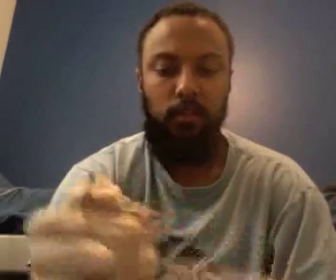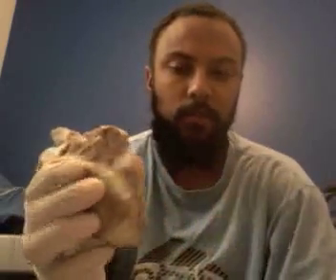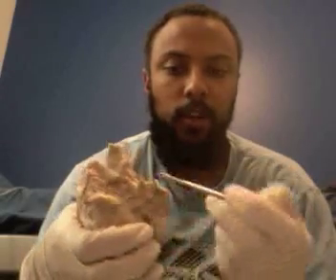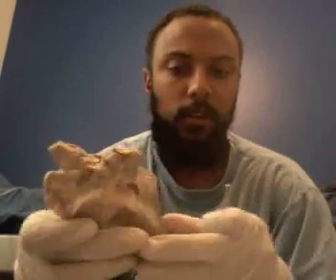A couple additions. Your auricles do allow for extra capacity for your atrium. When the body needs it, these will expand to allow extra blood flow into the atrium, normally during times of exercise. And also, we have your trabeculae carneae, which are the ridges in the ventricles.